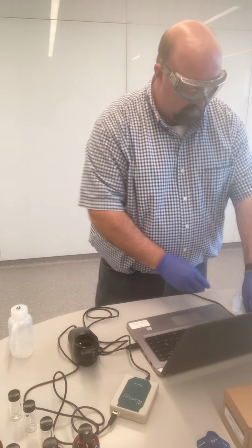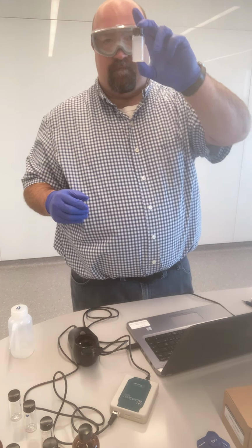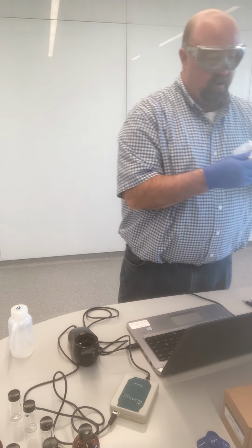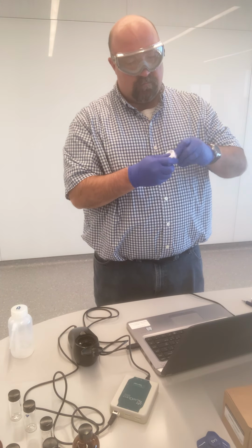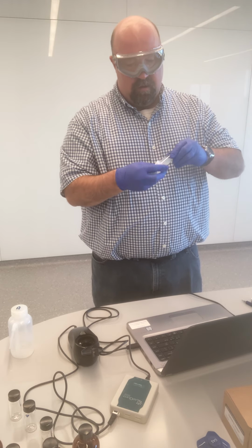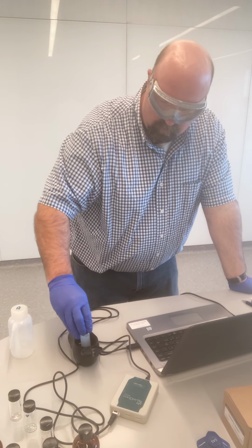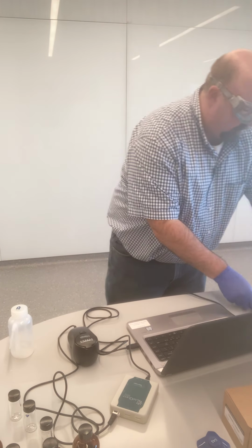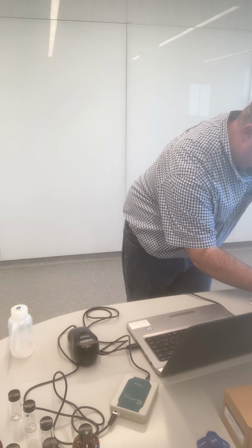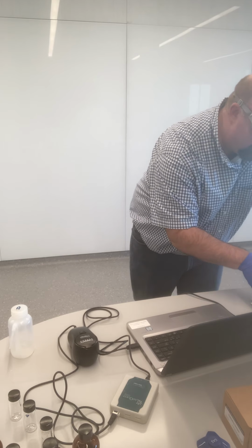Just as a visual observation, I should have shown you the others as well, but sample spot 4 is much cloudier than sample spots 1, 2, and 3 were. Sample spots 1, 2, and 3 visually didn't look that cloudy. Sample spot 4 definitely looks quite cloudy. And so sample spot 4, my initial measurement is 513 NTUs. Now that's a problem.